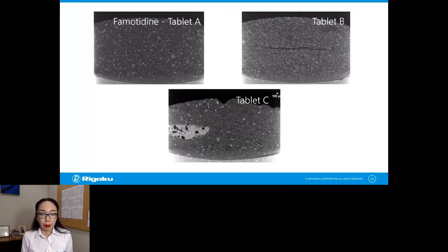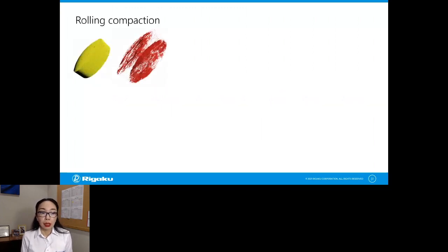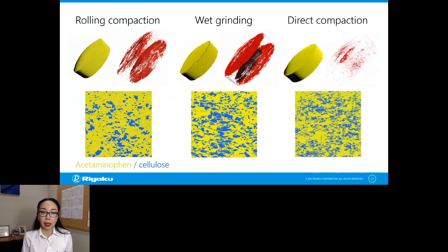Okay, let's think about different scenarios next. Let's say that you're trying out different compression methods and wondering which one works the best. Well, you can try different methods and see what you get using X-ray CT. For example, this is a CT scan of a tablet that was prepared by roll compaction. And the yellow one is the entire tablet. And those red areas are highlighted cracks. And you see clearly two kinds of planes or plates, indicating that the top and the bottom parts of this tablet are capping. You can also do a high resolution scan to see, in this case, an acetaminophen and cellulose mixture, and segment those two phases and see how well they're mixed. Now, that's for roll compaction, and you can do exactly the same analysis for wet granulation and direct compaction, for example.